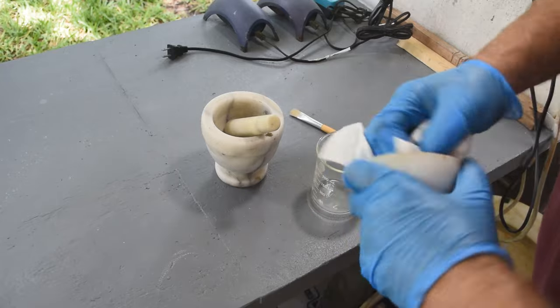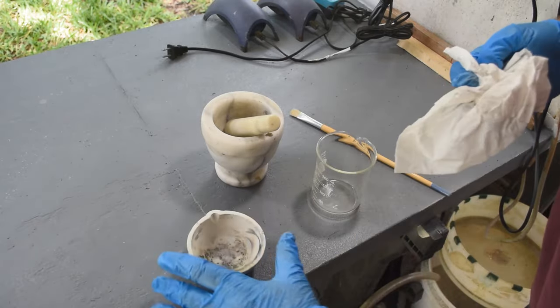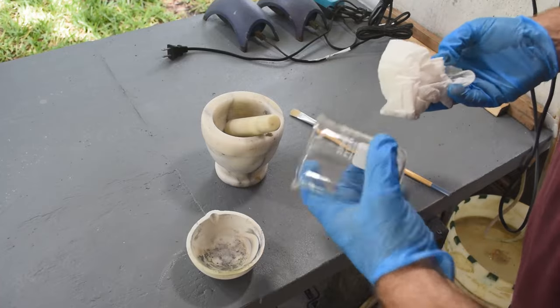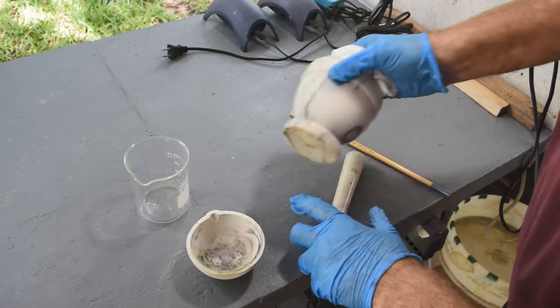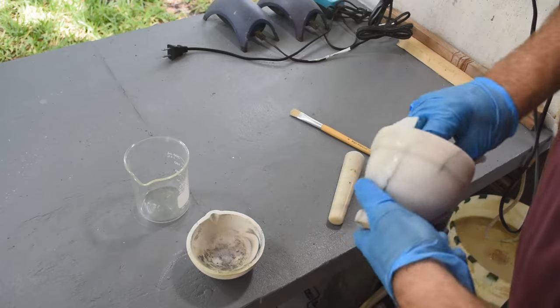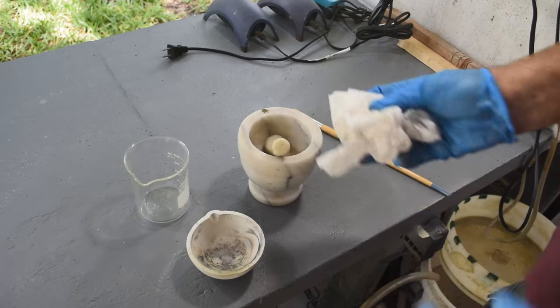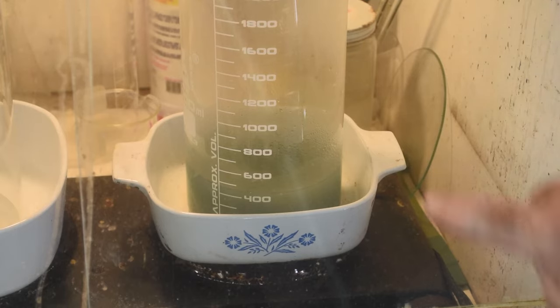While that's cooking in the fume hood, I'm going to wipe out these containers - I'll earmark this one just for stock pot work - wipe them all down to get the last traces of precious metal dust off of them, and store this paper in my rag and filter storage. We'll process it the next time I do my rags and filters.